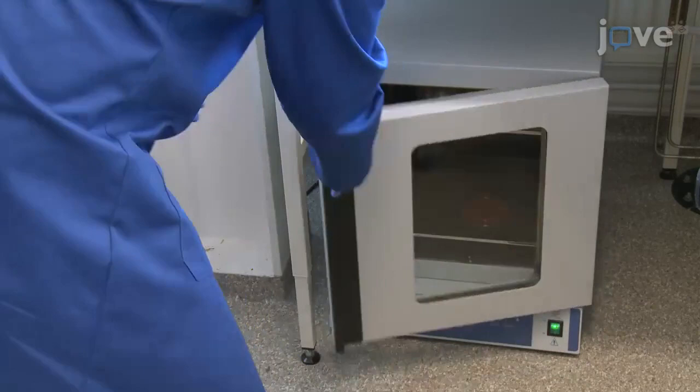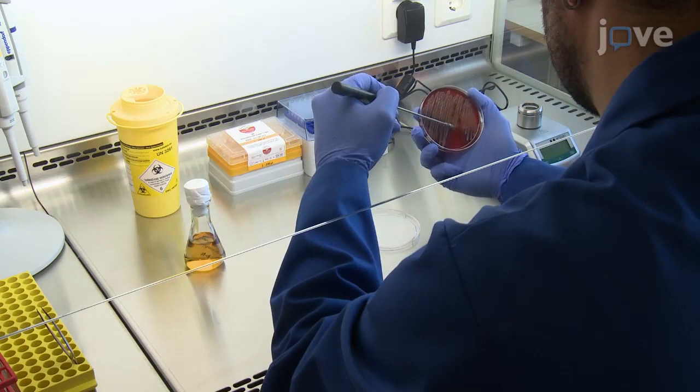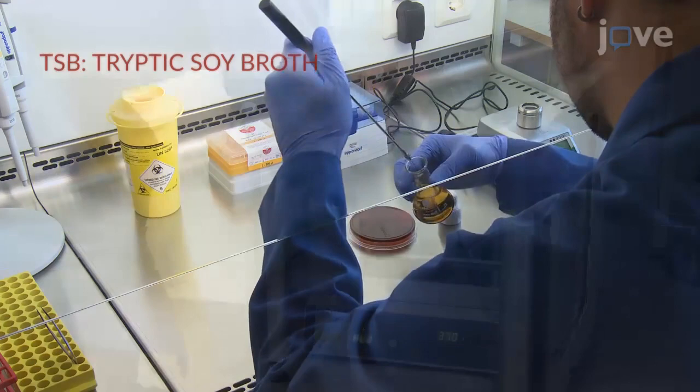For bacterial culture in liquid medium, transfer a single colony from a solid medium culture to 50 milliliters of TSB for incubation at 37 degrees Celsius for 24 hours at 200 rotations per minute.